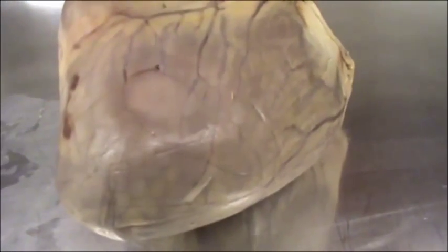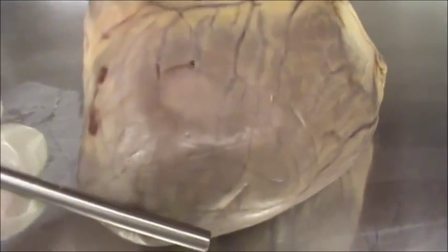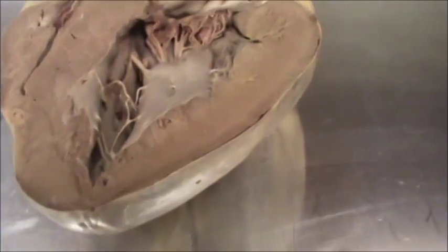The heart is divided into four chambers. We will look into the chambers internally and externally. To see the internal chambers we will dissect the heart — it is easy to start from the apex. So after dissection through the apex, this is how it looks.